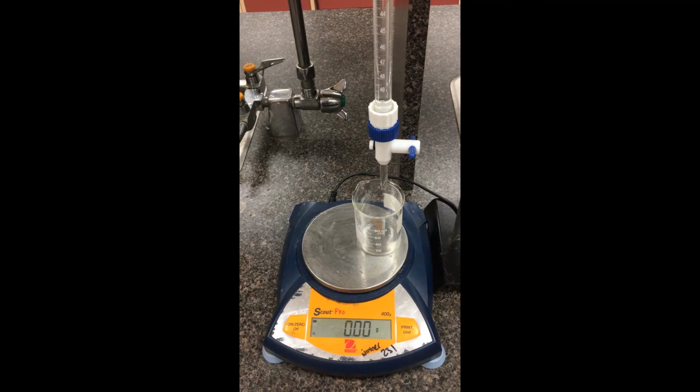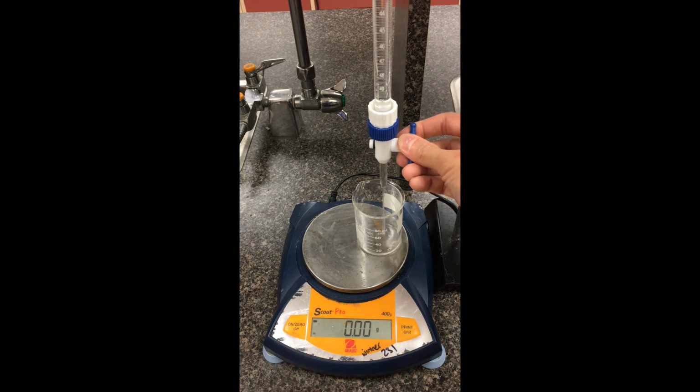Okay, so I've swapped out the solution here. I put the empty beaker back on the balance here. I've zeroed the scale. Now we're ready to measure the same mass and volume readings here for the salt solution. So again, 0 salt solution, we have 0 mass. Again, I'm going to go up in increments of 3 here.